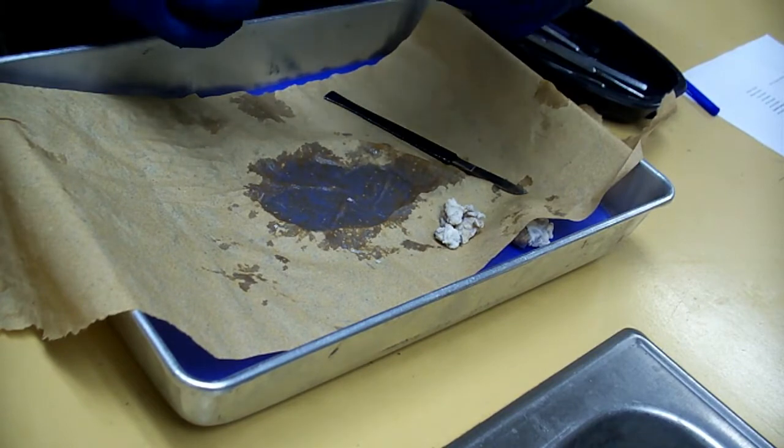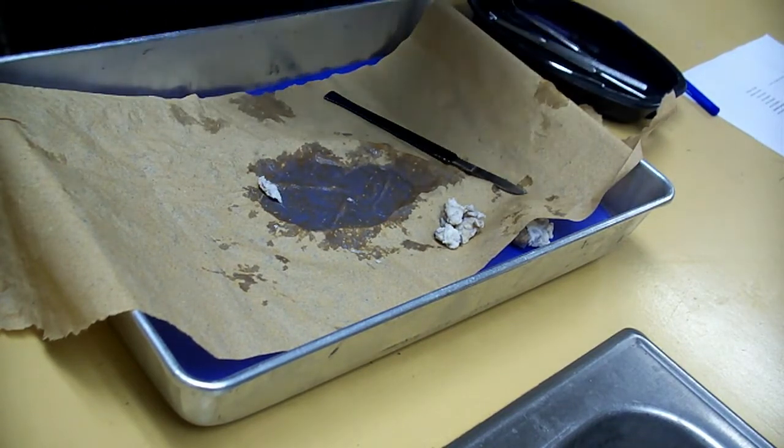It's squishy. Did you pop it? No. Okay. I jacked it up. Can you jack it up? No, it's okay. It's going to be jacked up.